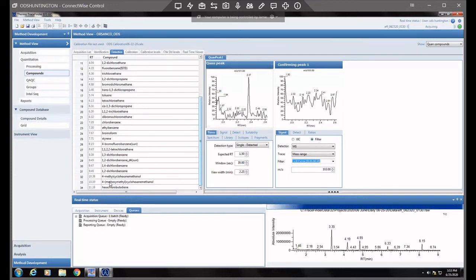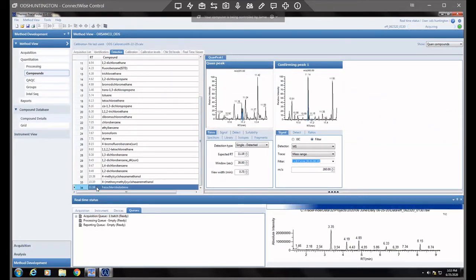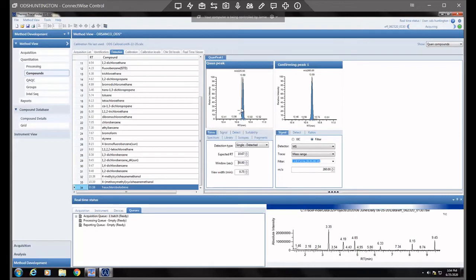So here we can see this compound is listed at 1118, which our compound came off at 1067. The easiest way to do this is, when you click on it, over here comes up the quantitation peak and then confirming peaks. So here's your expected retention time. We're telling the software right now that at 1118, that's when this compound comes off. But it looks like that changed. So we're going to go ahead and change it to 1067, and you can click off of it and it'll identify the new peak.